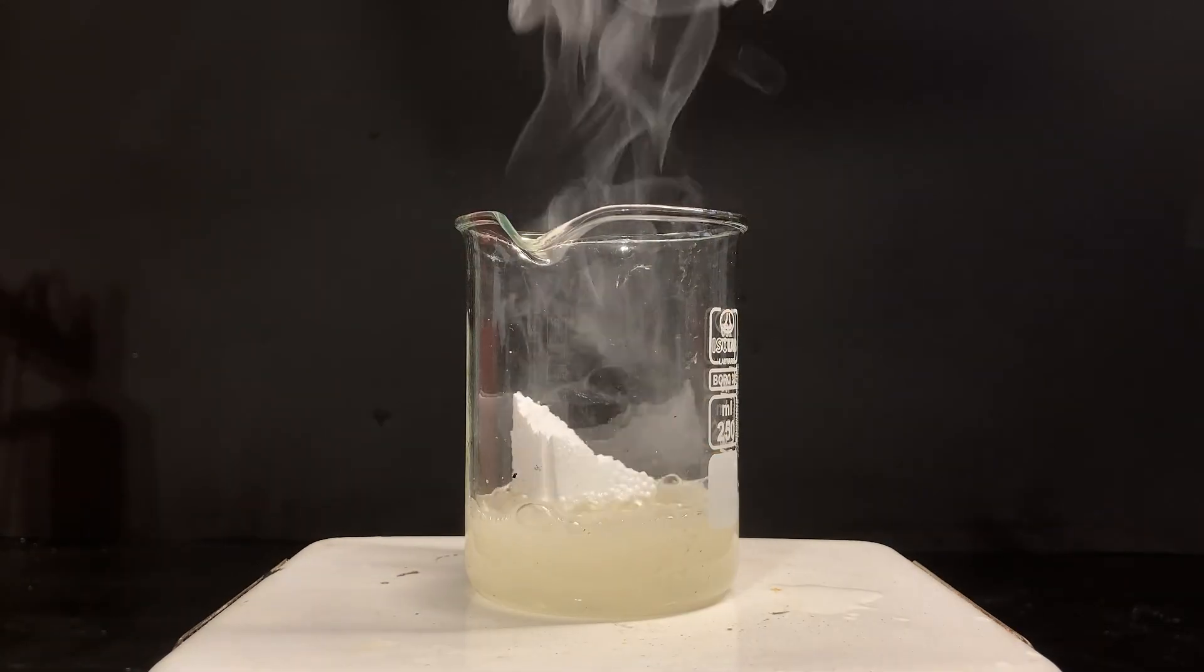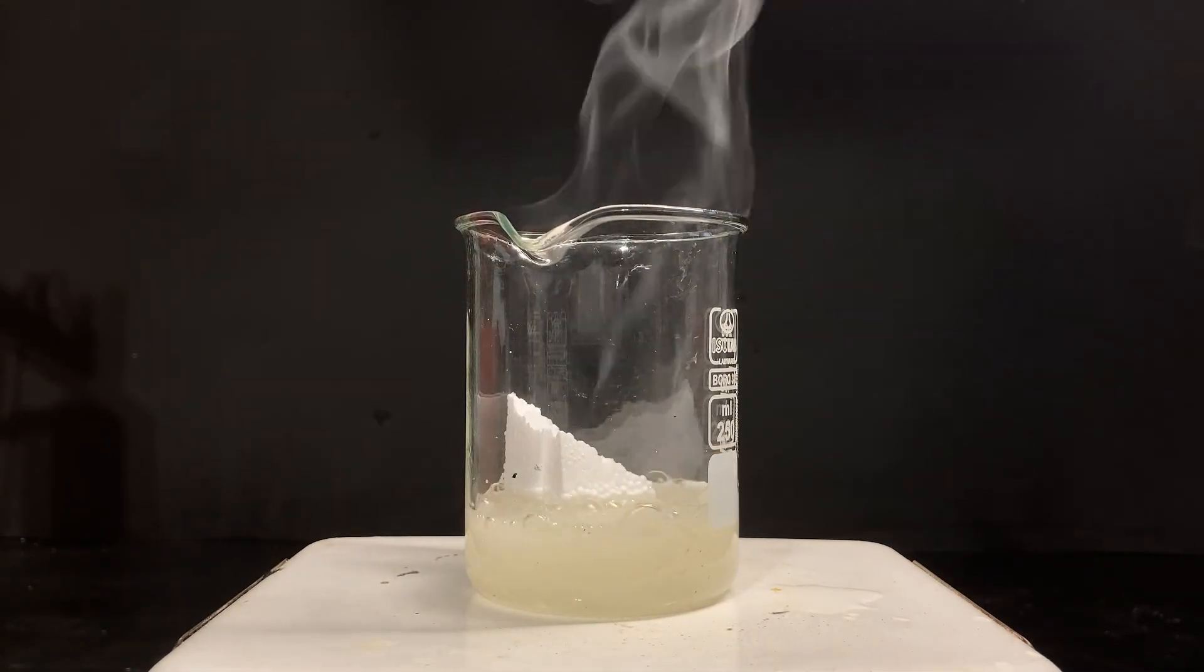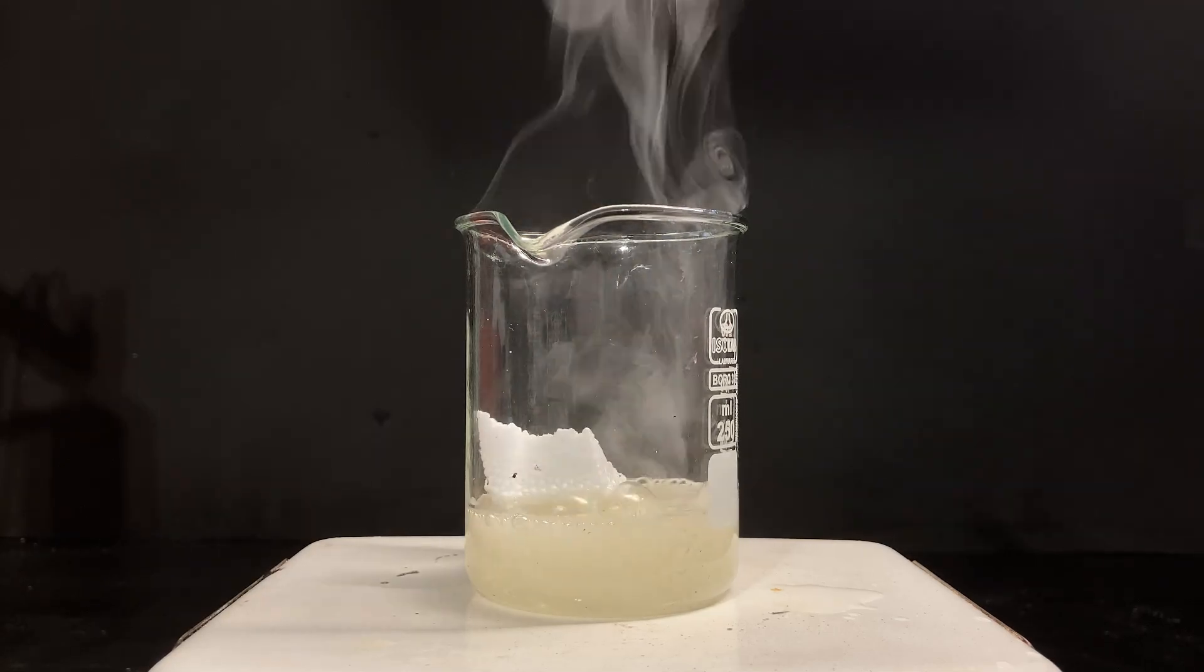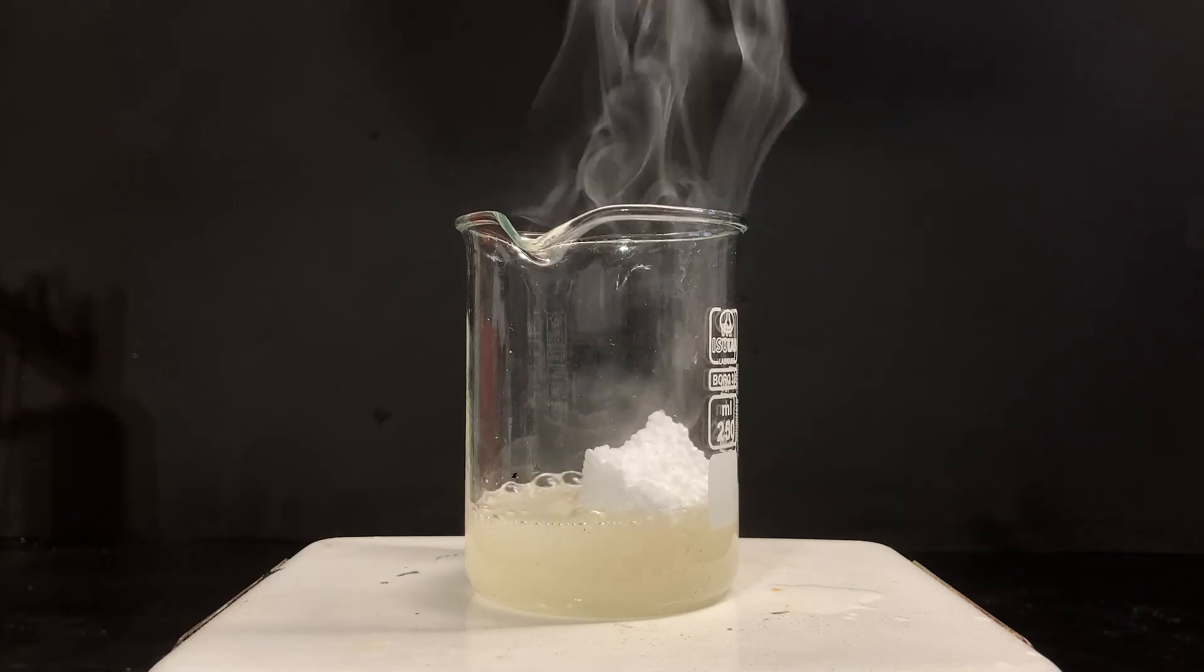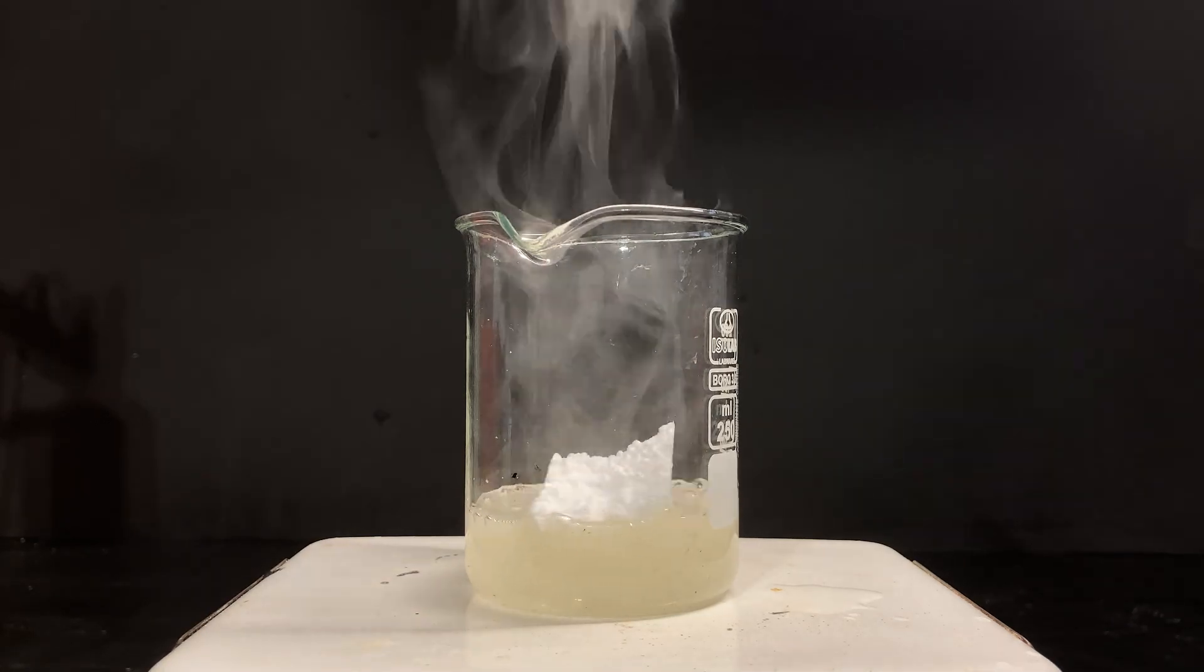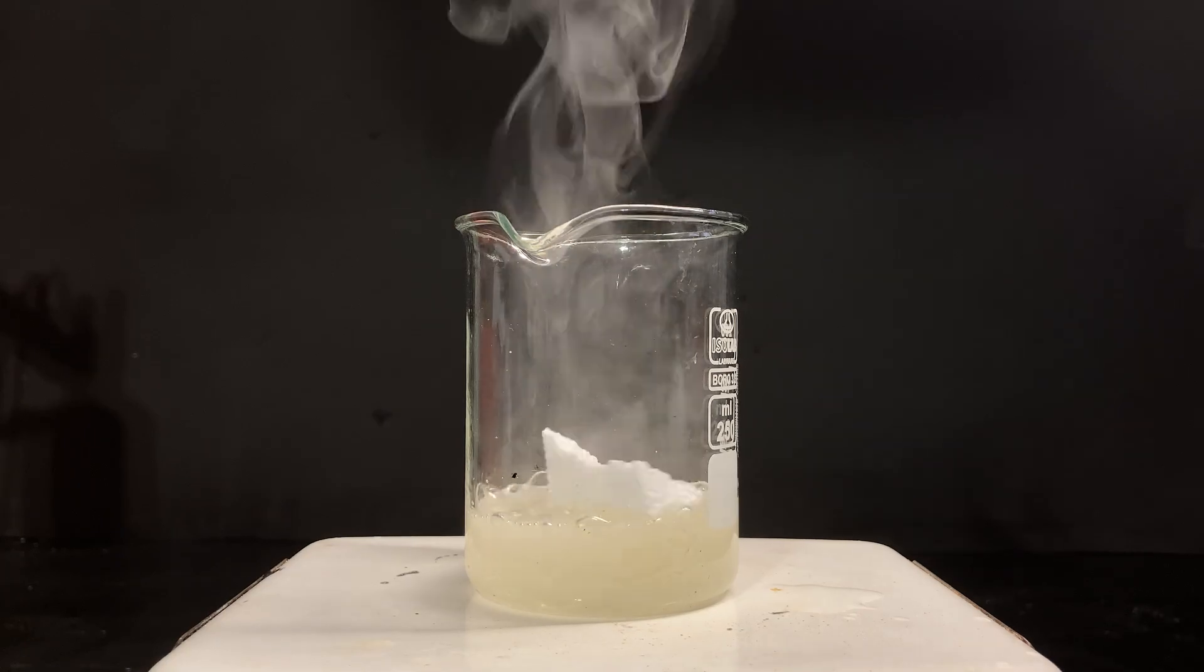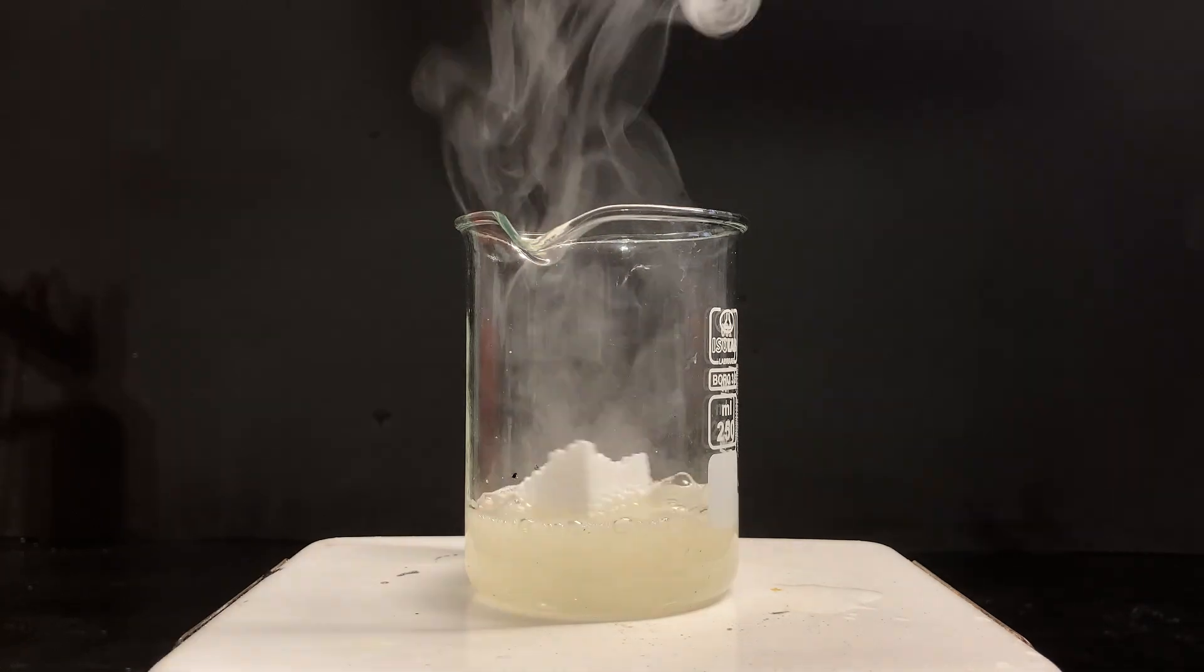The only thing that didn't get dissolved, strangely, was styrofoam. Maybe because it's a polymer polystyrene and that the bonds holding it together were quite strong, or maybe it's because I just didn't leave it there for enough time. I'm wondering if anyone has an explanation for this as I thought paper was a polymer as well, also known as cellulose.